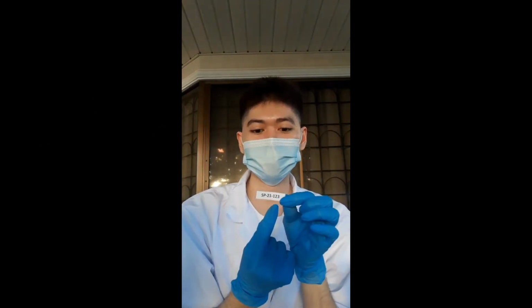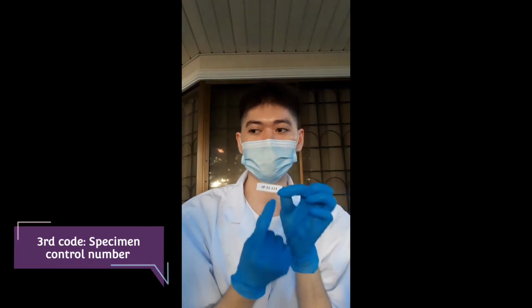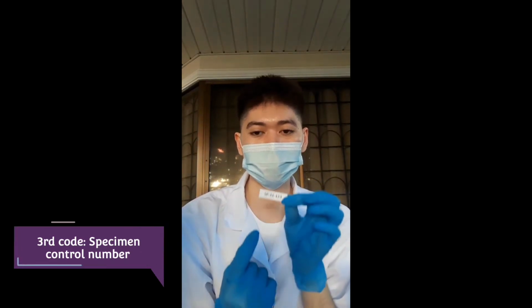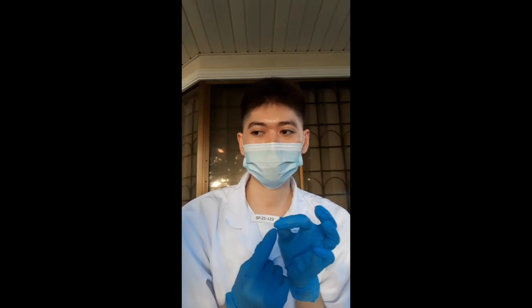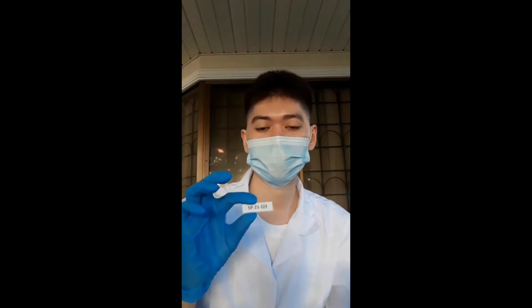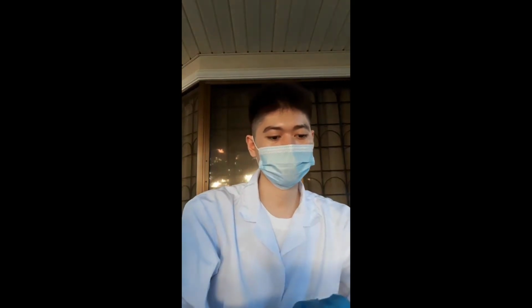And next, for the third code, it is the specimen control number. So the meaning of 123 is that it is the 123rd specimen that was received in the lab in that current year. And for multiple samples in one patient, we designate a letter after the control number. And this letter tells us that it's a different specimen from the same person. So now I'm going to put it in our specimen container.